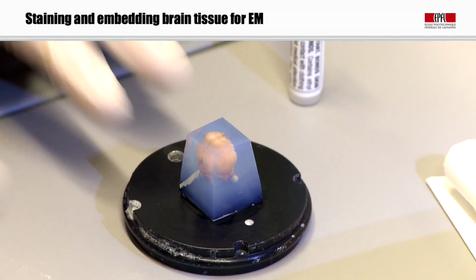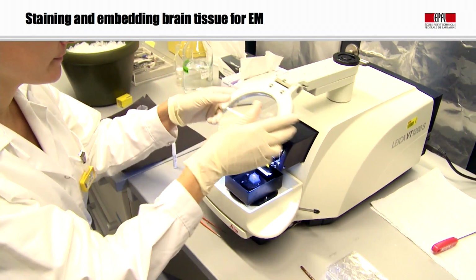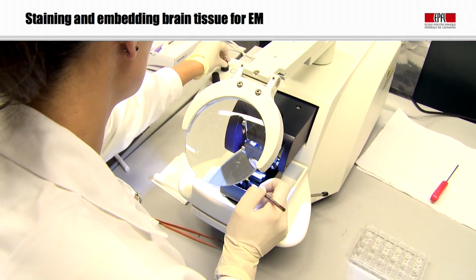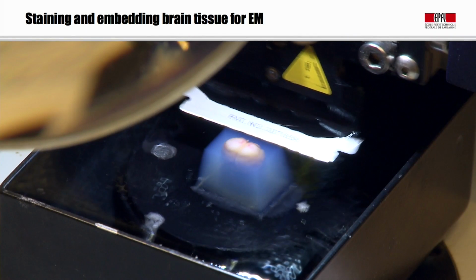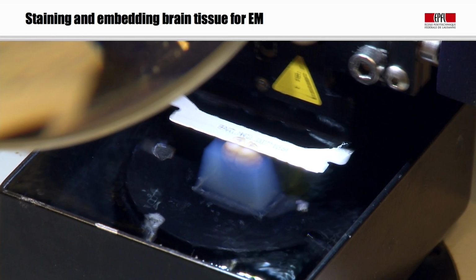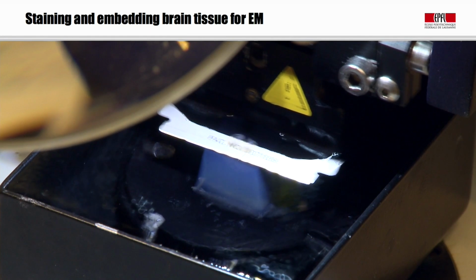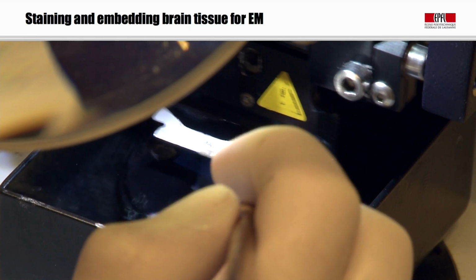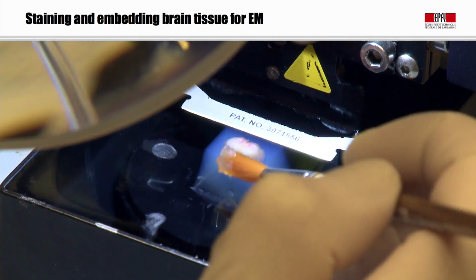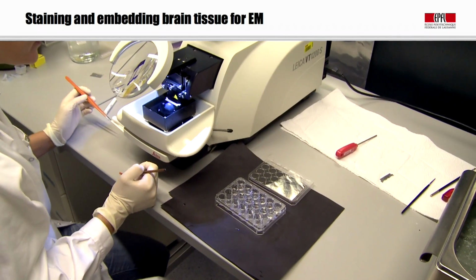The metal holder is then placed into the vibratome. So it's then put into the bath of the vibratome that's containing a buffer. And this machine simply contains a vibrating razor blade that moves across the surface of the block, cutting sections of the brain. And this can cut sections of between 50 and a few hundred microns thick. And it allows us to get access to exactly the brain region we want with these very thin slices that we can then image directly under the light microscope to actually check whether we're in the right region of the brain. But if we imaged it with a fluorescent microscope, we could also see fluorescent markers.